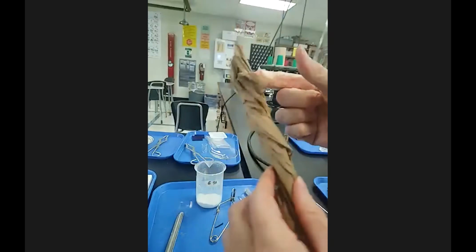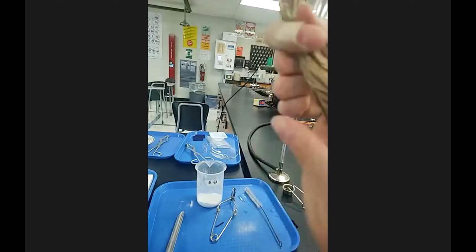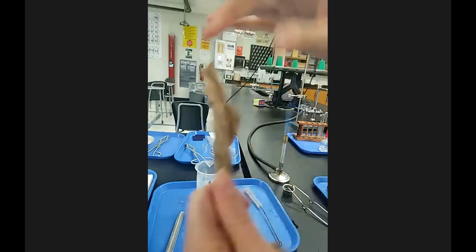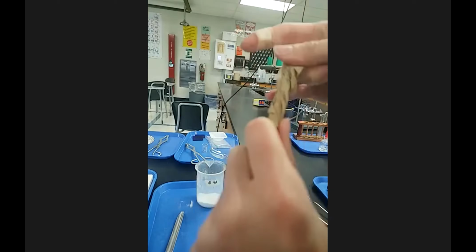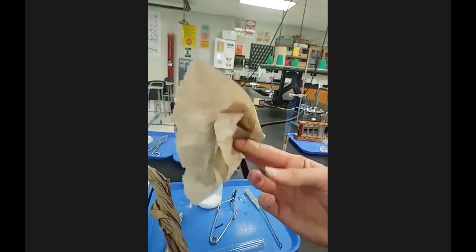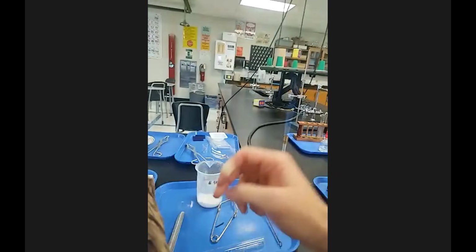So you take a piece of paper towel and you kind of roll it. So let me put this down, roll it. And I'm not going to try and set paper towel on fire today, right? That's not the goal like last week. And so that it's narrow, because you don't just want a piece of paper towel like this. It's not going to go in your test tube very well.